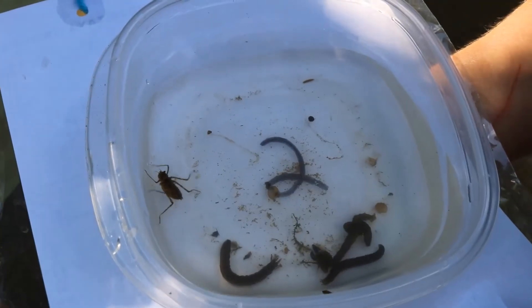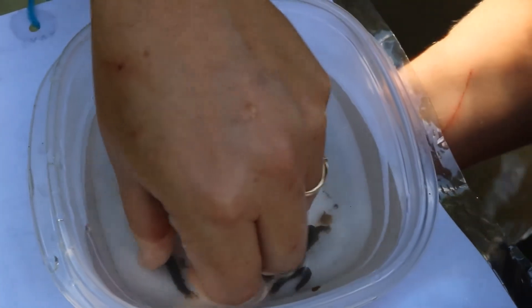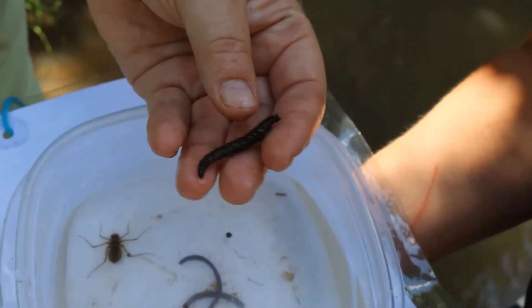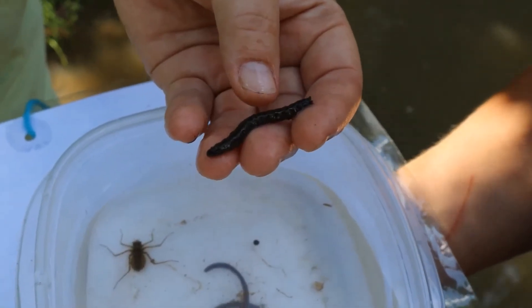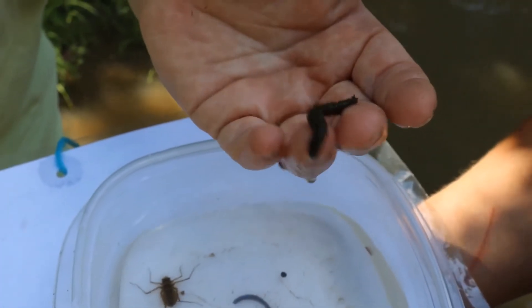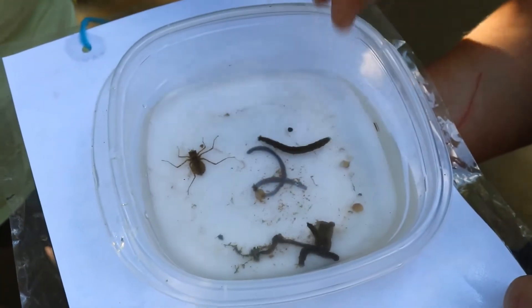Group 2 taxa can live in intermediate water — both good water and intermediate quality. We have something that kind of looks like a worm, but this is a crane fly larva. Everybody always wonders what crane flies are. This is eventually going to hatch out into those big mosquito-looking things that fly around — but they're not mosquitoes. People think they're giant mosquitoes, but they actually eat mosquitoes. It's amazing this ugly thing can hatch into something as delicate as a crane fly. These will probably hatch yet this fall given how large they are.